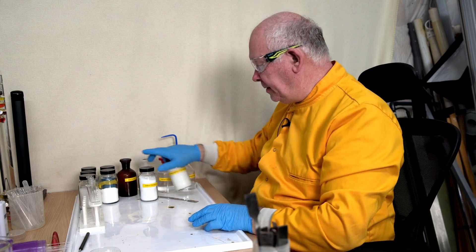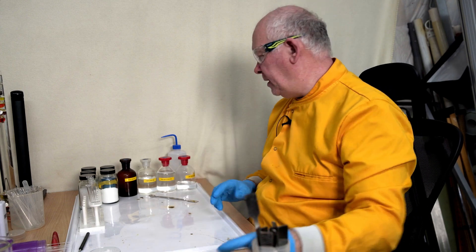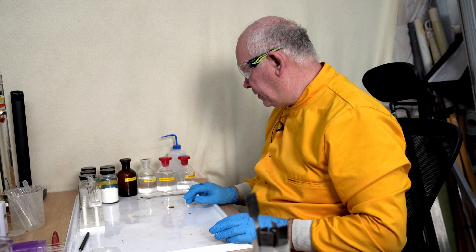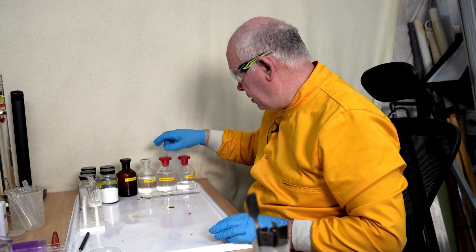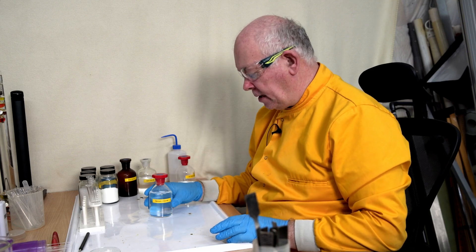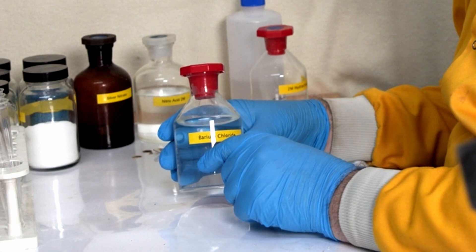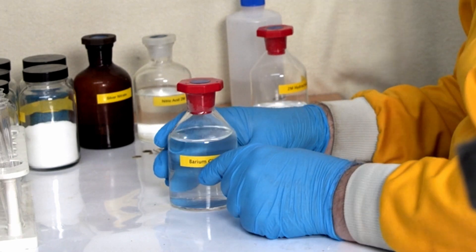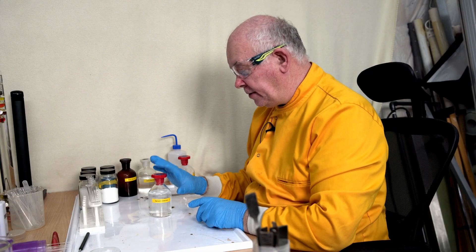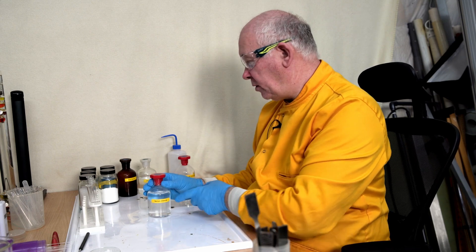So our next job might be to have a look and see if it is something else. We could test now to see whether it is a sulphate, and the test for sulphate is typically adding barium chloride. And if it is a sulphate, then we're going to get a precipitate formed.